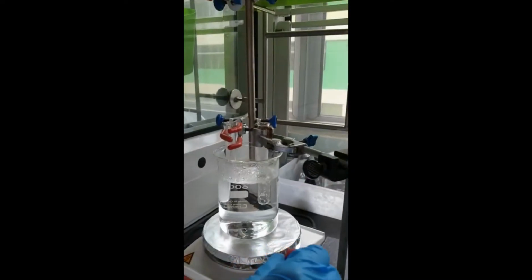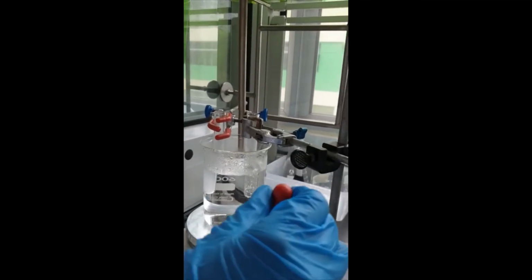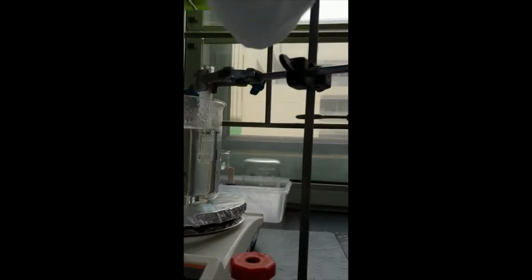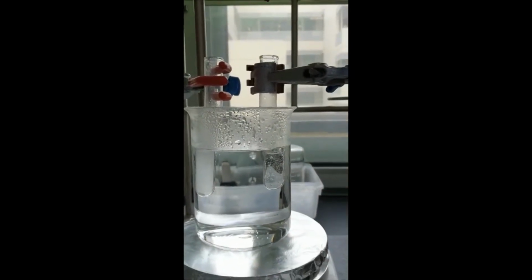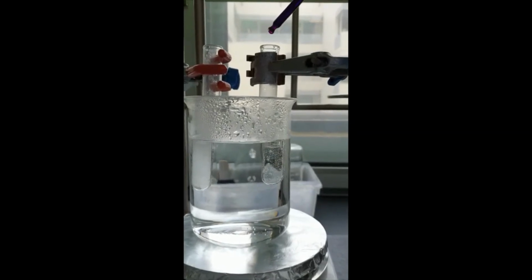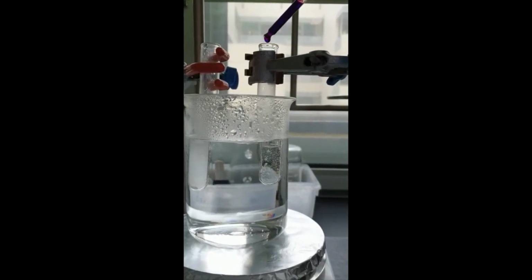Jonathan and May went back to their worksheet to look at the structures once again. They decided that they will use an oxidation reaction to test for the secondary alcohol present in ambroxol and not loperamide. They prepare fresh samples again and heat the test tubes once again.